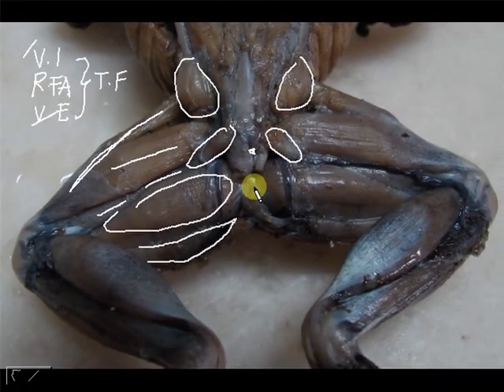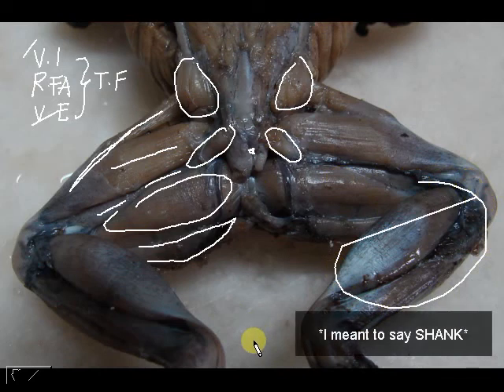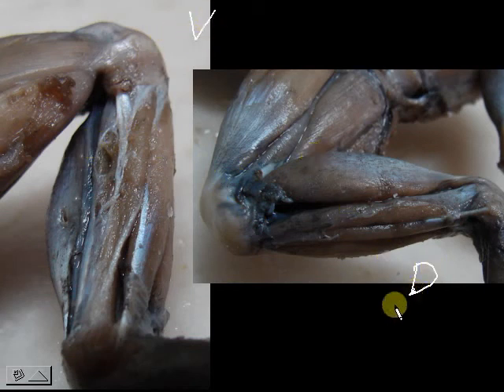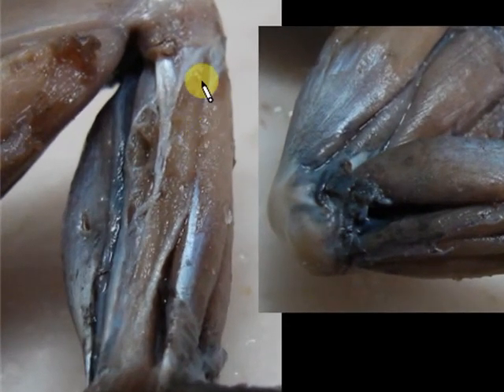Now let us move on to the muscles of your shank. Let us look at a better view. This is the ventral view, and this one is the dorsal view. Let us first look at the ventral view of your shank.